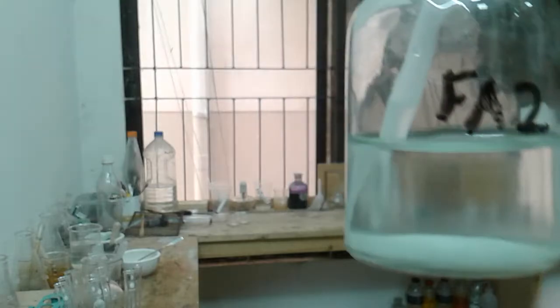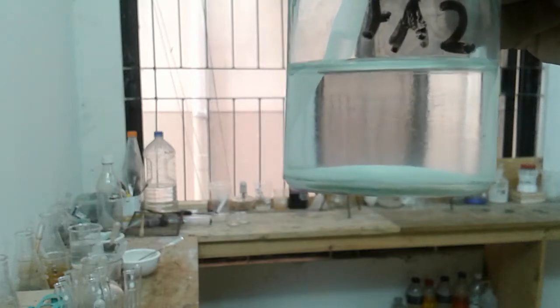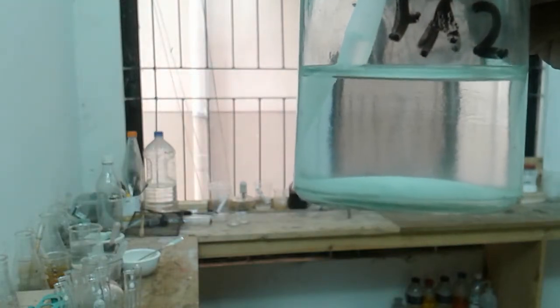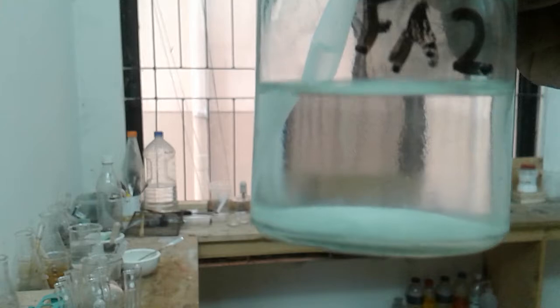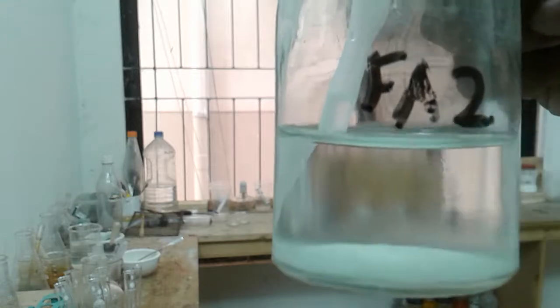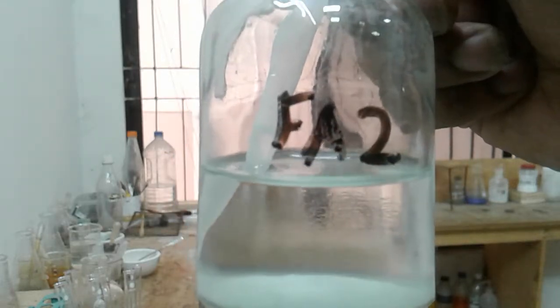There must have been deposits of some precipitate over here, but look, there is no deposition of precipitate, isn't it? So since you have identified the presence of sulfate, this solution must not contain barium, because if it did, the barium and the sulfate would have produced a precipitate, not this colorless solution. Barium sulfate is a precipitate, which may be the test for sulfate or barium. So since this solution contains sulfate, it does not contain a barium ion, because the solution is a clear solution, isn't it? This will be the answer.